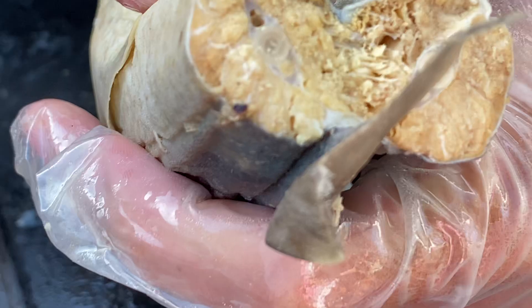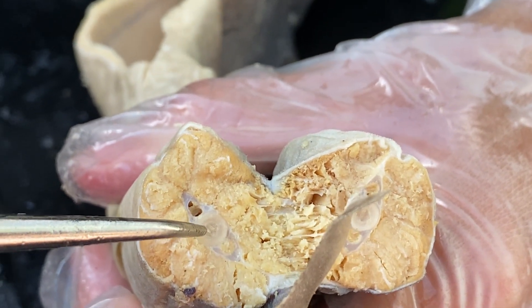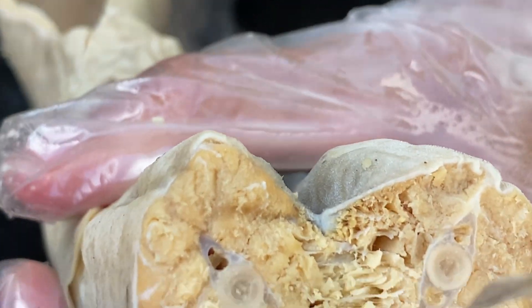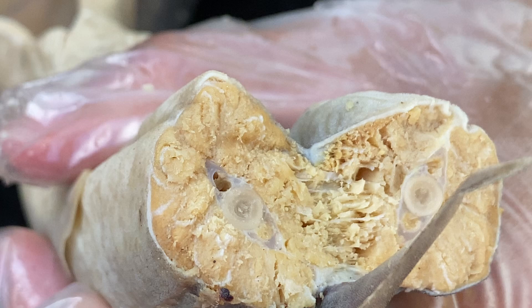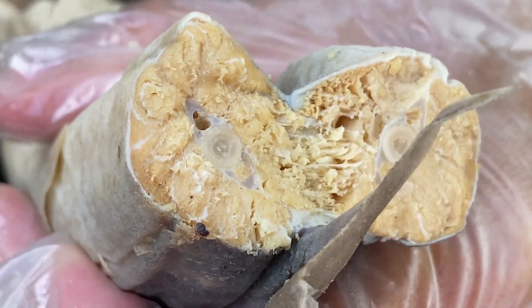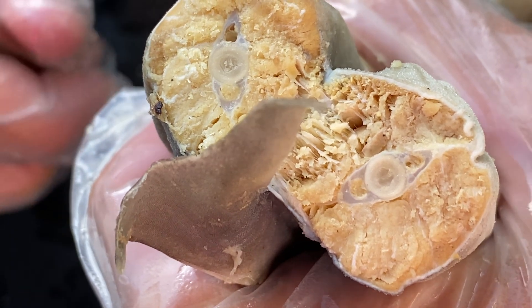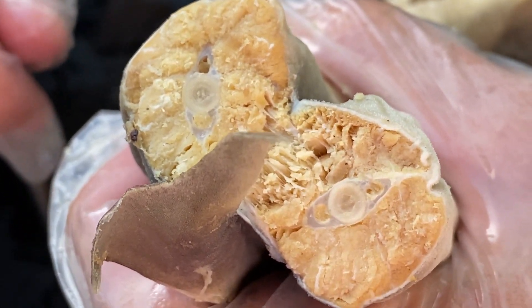You can see a cross-section of the shark. In the very middle is the spine — and again, it's cartilaginous, cartilage skeleton, chondrichthyes. In the very middle of the spine would be your spinal cord. And then if you notice all that yellowy stuff, these are all the muscles. They're very muscular, very strong animals — you can see the nice striations. Fish are cold-blooded animals, so sharks are fish and they are cold-blooded. But the great white shark — what they have found is that the great white shark is actually a warm-blooded species. They have different muscles just like we do: fast twitch for sprinting after prey quickly, and slow twitch muscles in the tail base for consistently moving at nice slow speeds cruising through the ocean. For the great white, because they are so big and continuously swimming long distances, their slow twitch muscles are actually firing off enough energy to consider the great white shark to be a warm-blooded species — which is pretty awesome.